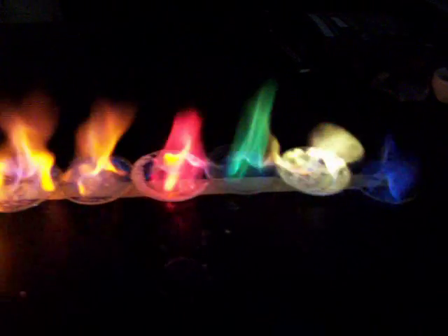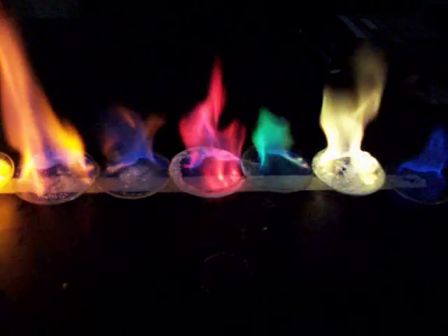A dramatic version of the flame test demonstration. First we have alcohol burning blue, then we have barium — some barium chloride with barium ions — burning a yellow, dirty yellow color.